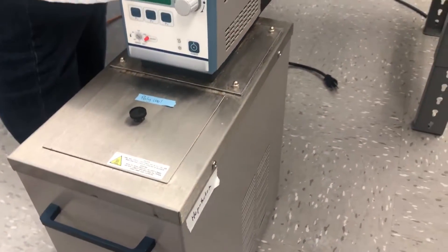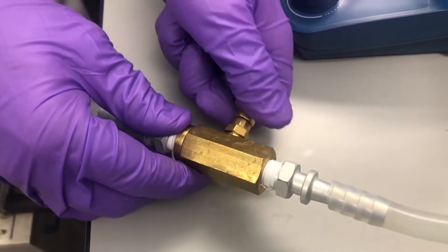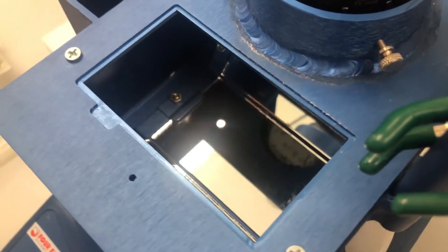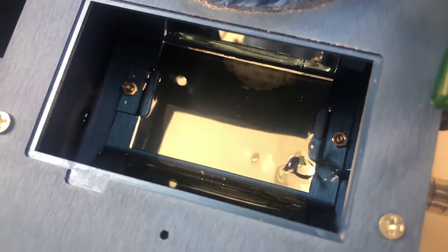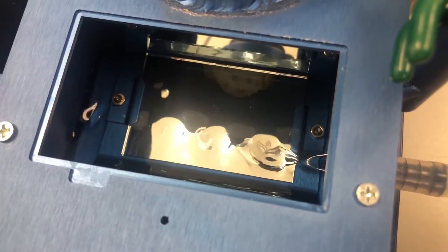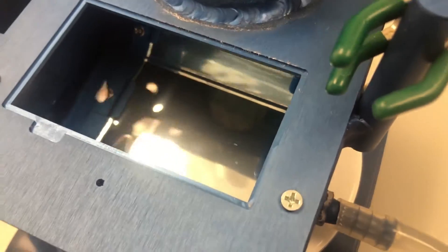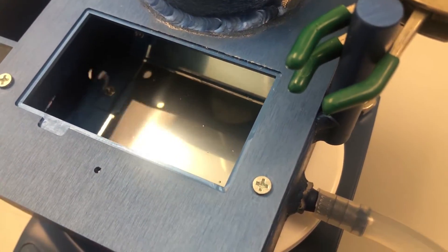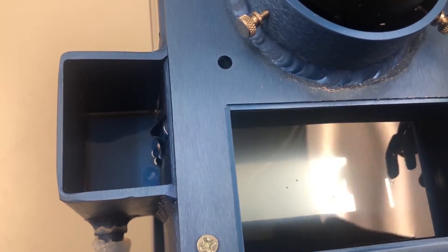When you are ready to use the Photoredox Box TC, place your chiller unit near the photoreactor and connect the chiller unit's flow end to the photoreactor's entry port and the suction end of the chiller unit to the photoreactor's exit port. The ports are designed to accommodate 3/8 inch tubing. Once everything is connected, initiate flow to the photoreactor and monitor the reaction chamber as it fills with fluid. The chamber will hold approximately 200 milliliters of fluid before reaching the overflow hole in the exit chamber, which connects to the exit port.